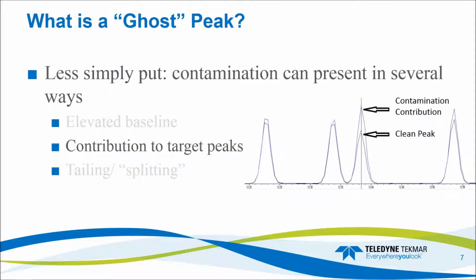Here would be an example of contribution to target peaks. So for instance, in this clean system, this would be the expected peak area or peak height that we would see for this compound. And when we have a contribution of contamination, whether that be carryover of that same target compound or a foreign compound that shares the target ion, we see a larger peak here. And so this can cause false positives. It can skew our calibration if it doesn't occur in every single sample, only in some samples, things like that.